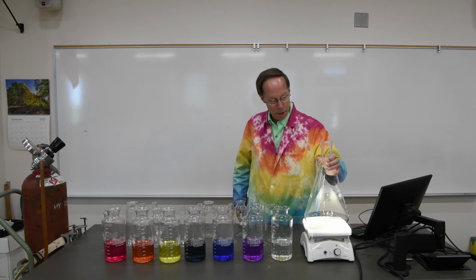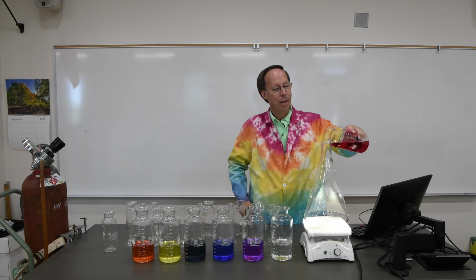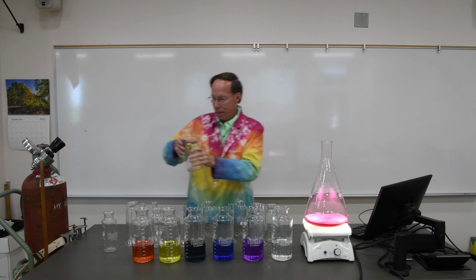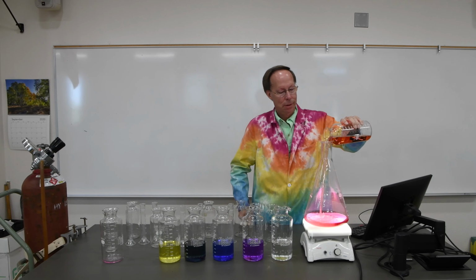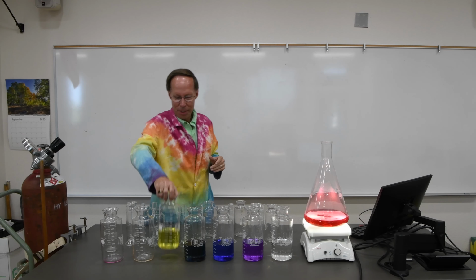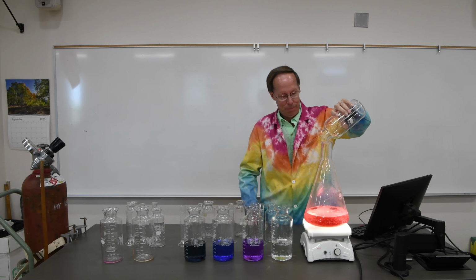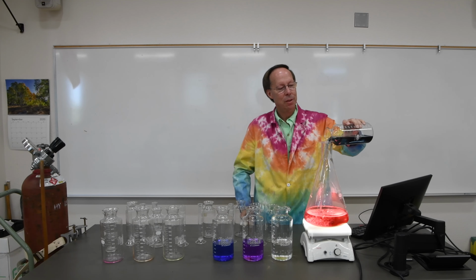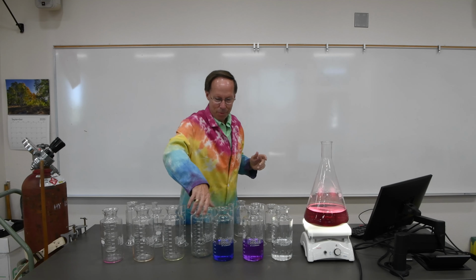Let's take all of our beakers and we'll put them together in this one flask. So we'll start with our red. And now let's add that lovely orange color. Well, so far it doesn't look white, it just sort of looks red-orange. We'll add some yellow to it. Yeah, well, still looks sort of orange. We'll put some green in there. Yeah, still not colorless. Let's see what the blue does to it.